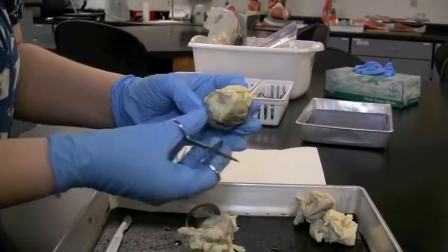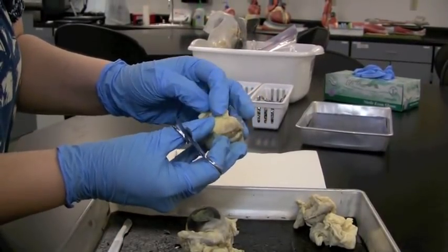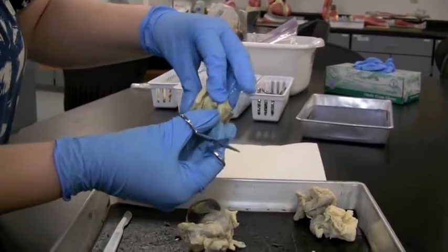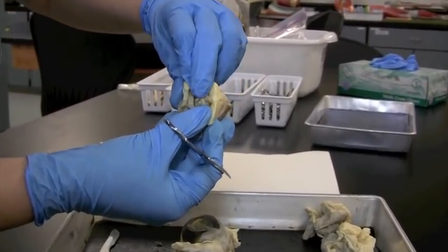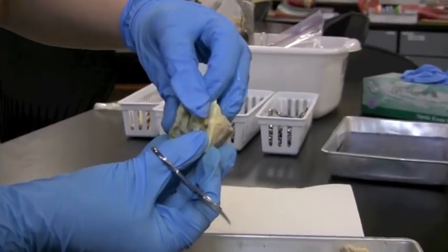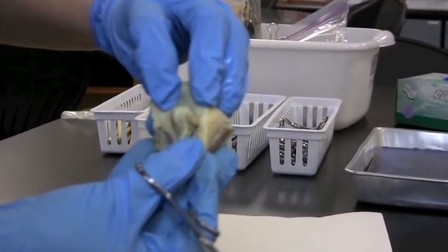I've been trimming for a while. Just wanted to show you back here in the back, this little portion that's sticking out, this tube. That's the optic nerve. So I'm going to try and avoid that as I'm cutting away the rest of this tissue.